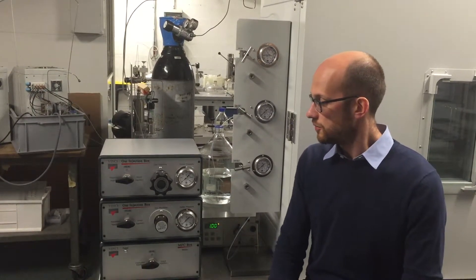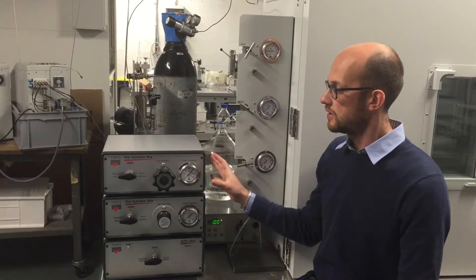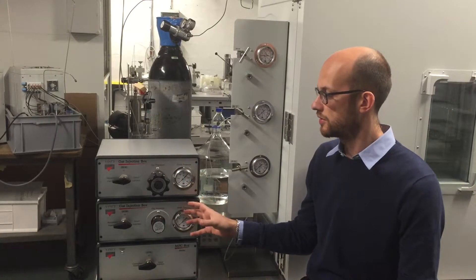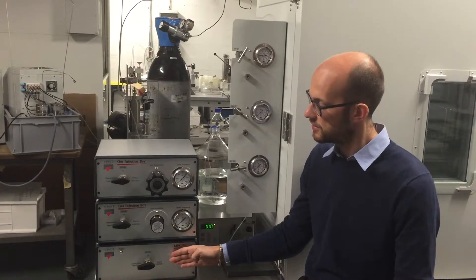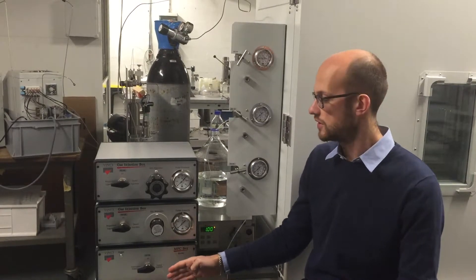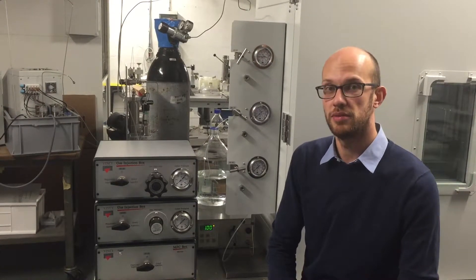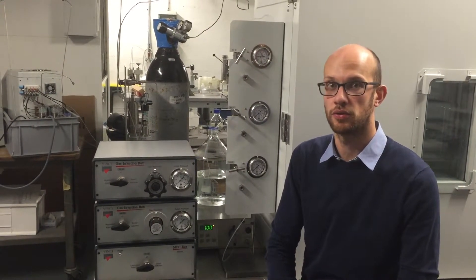In the steam flood, we also have a high pressure gas line. Here, we have two possibilities for constant pressure mode using two gas regulators, and also the possibility of injecting a constant flow rate of gas using a mass flow controller. At the bottom, we have a humidifier that can be used to wet the gas before injecting it through the core holder.